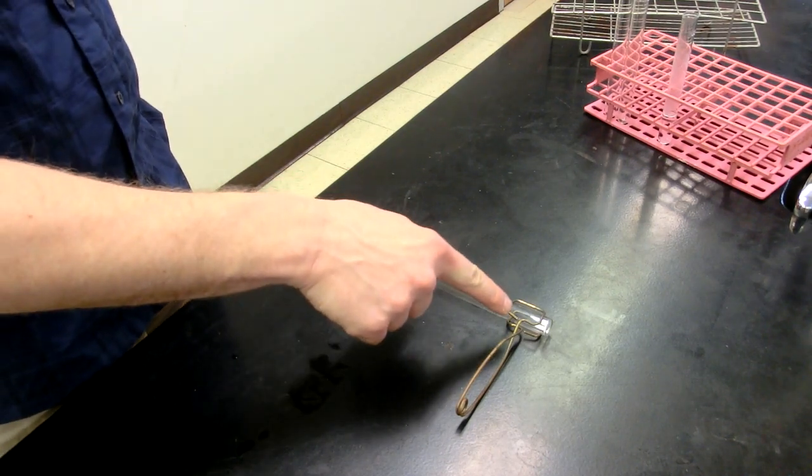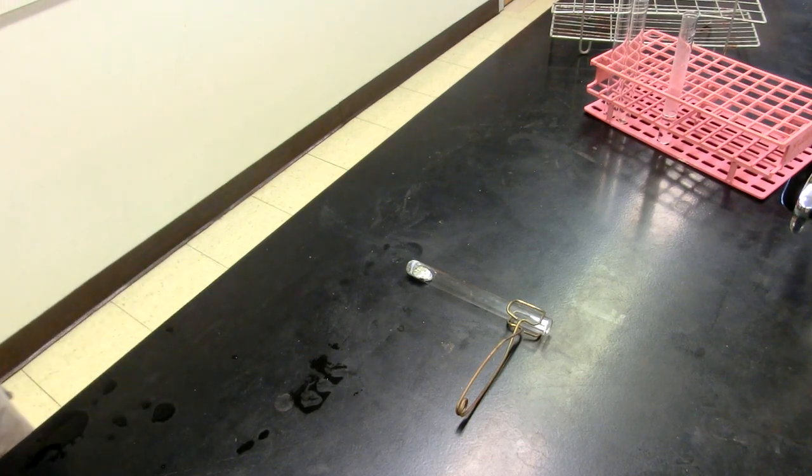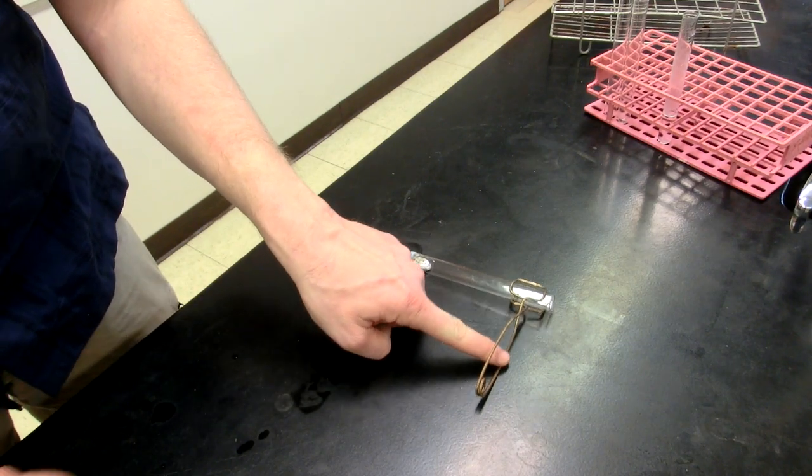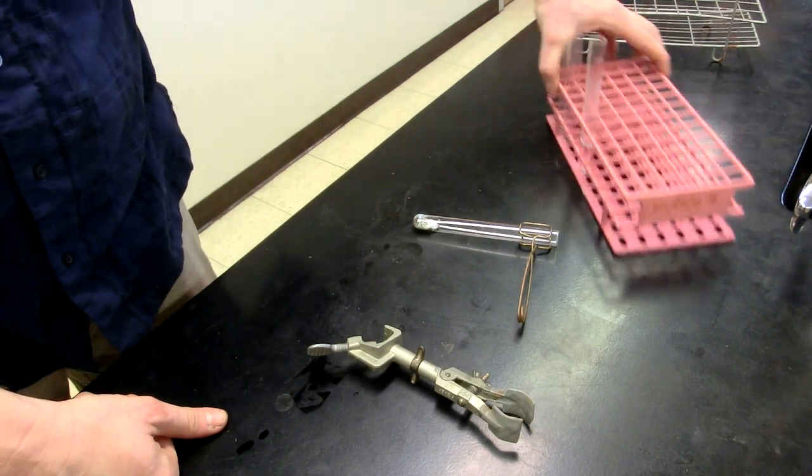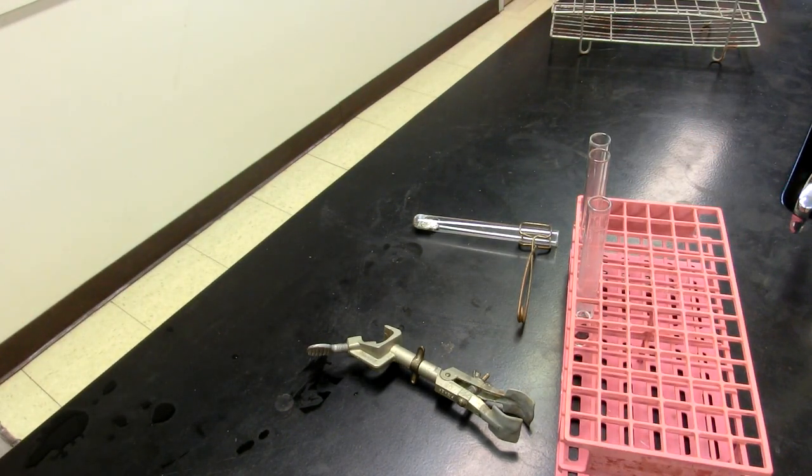But if you leave the test tube holder on it and just set it on the countertop, you should be just fine. That concludes the instructions of how to use a test tube holder and heat up a test tube. This once again is a test tube clamp and this is a test tube rack. Have a good afternoon.